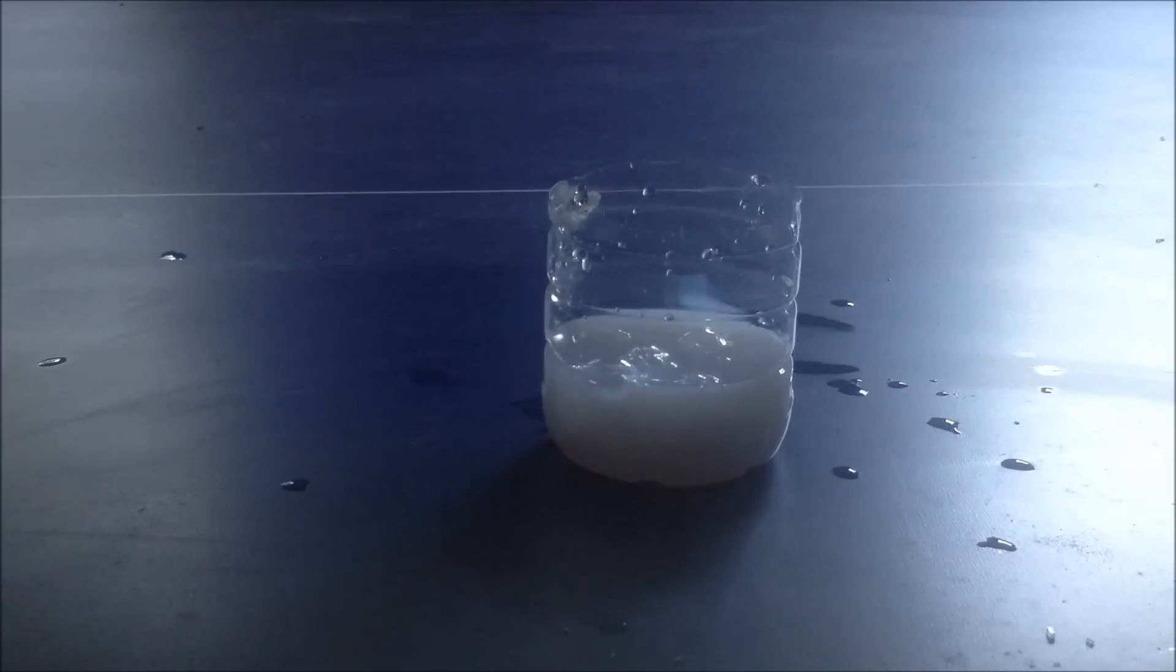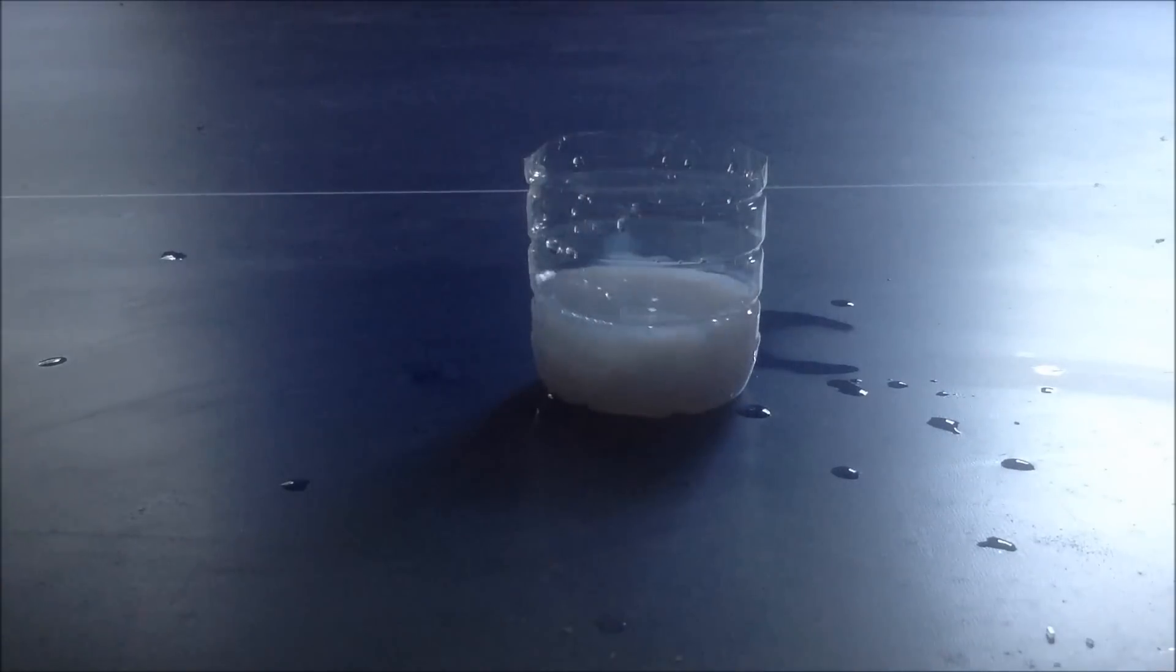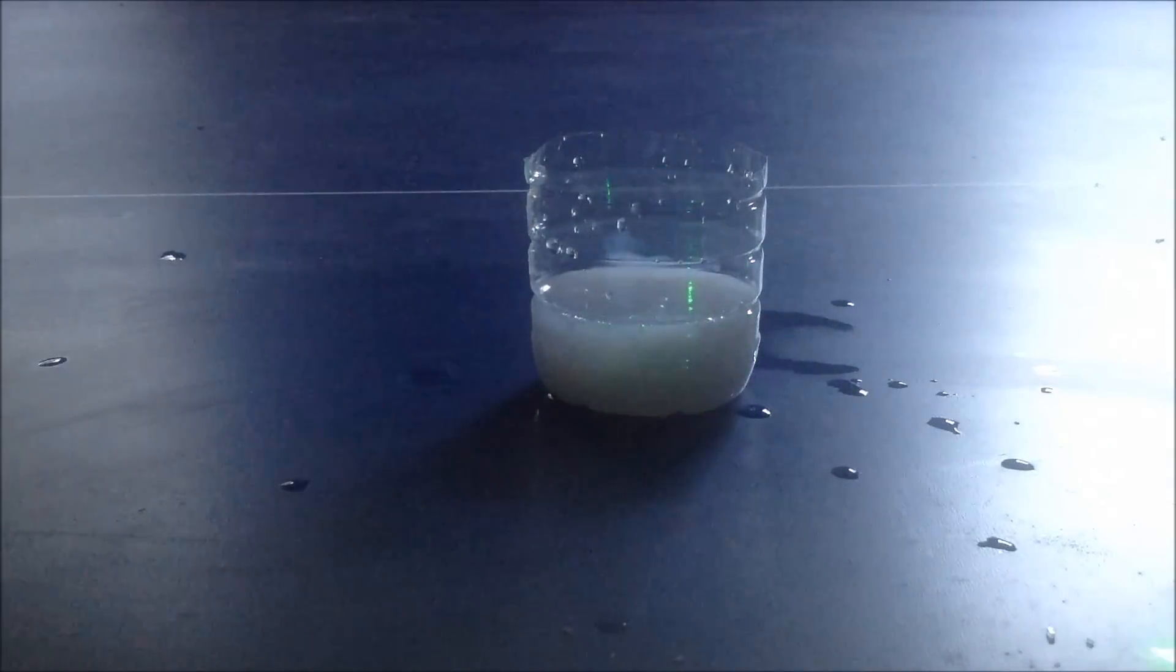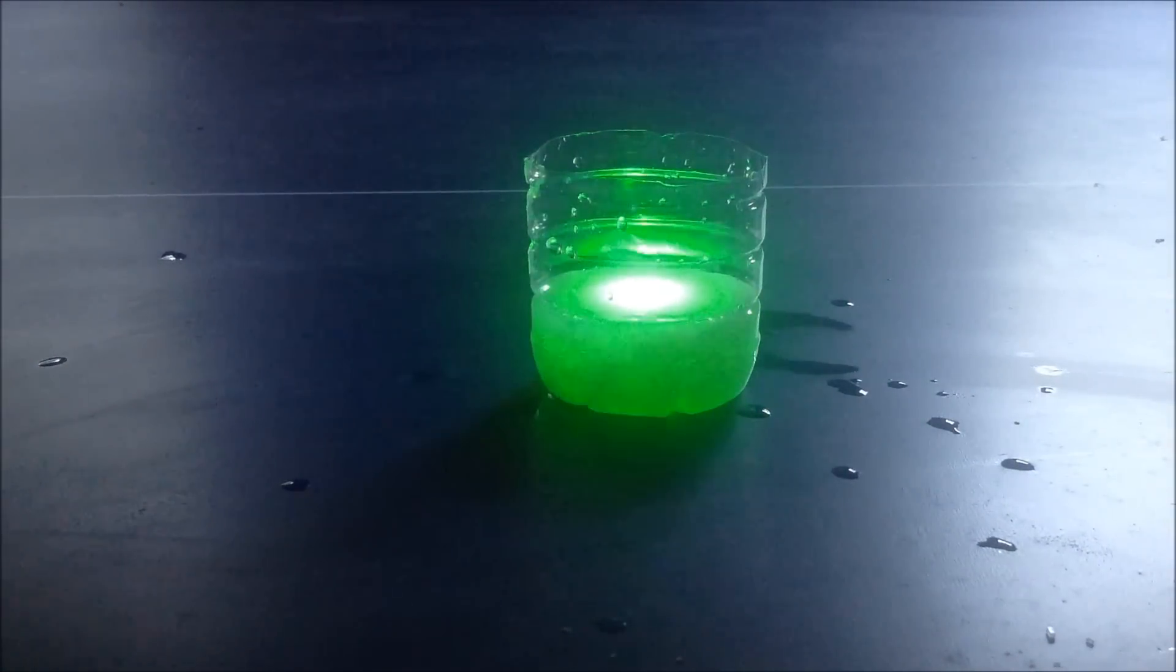Instantly turned milky white. Sorry if you can't really see that well. Okay now you can see it. Shine this laser pointer through it and you can see how it's milky white. Shine it from above. That looks cool.